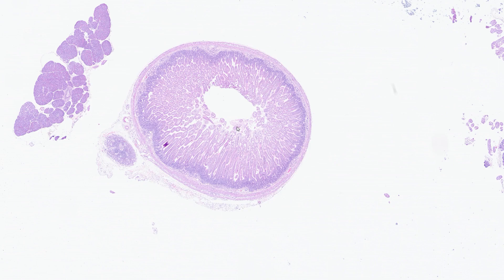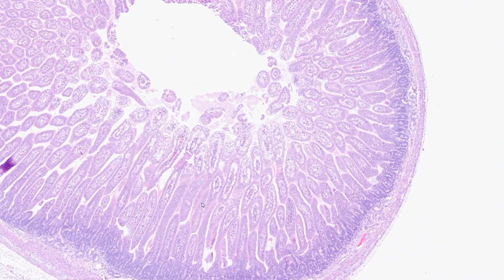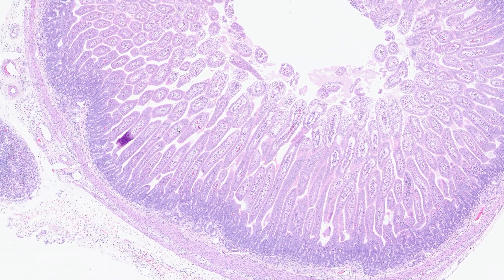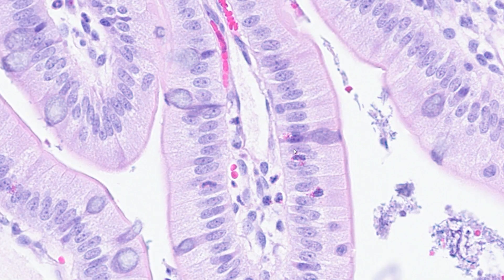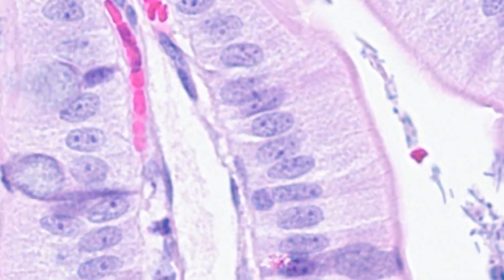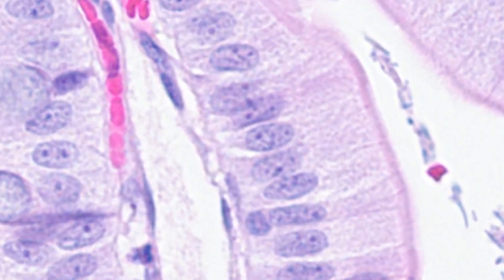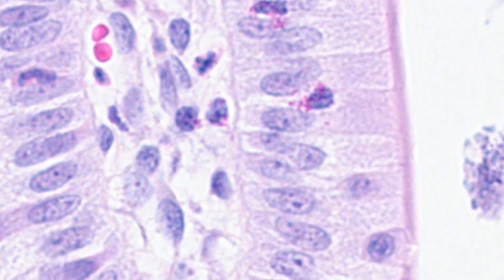Hello and welcome to Down the Scope. Today we'll be looking at the histology of the small intestine. The small intestine is a site of further digestion but also absorption of nutrients. Both of these processes happen at the cell surface membrane of enterocytes, the epithelial cells of the small intestine. One of the most important aspects of the small intestine's microscopic structure is maximizing surface area.